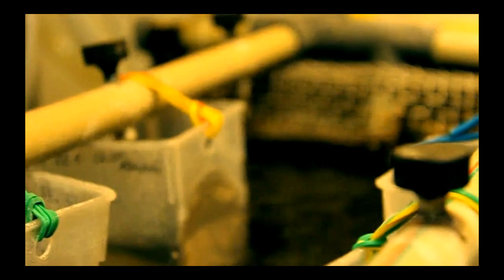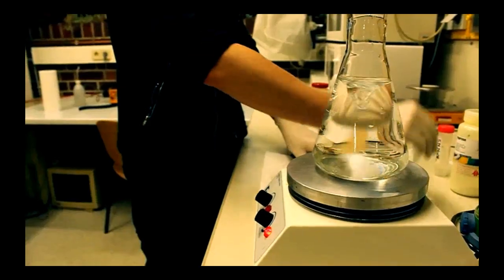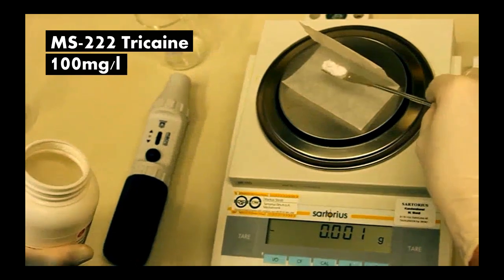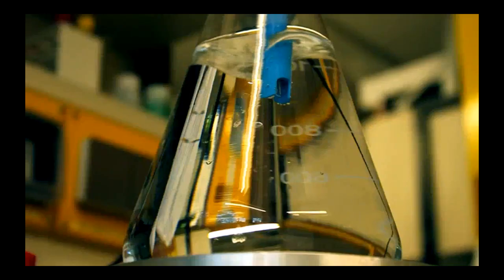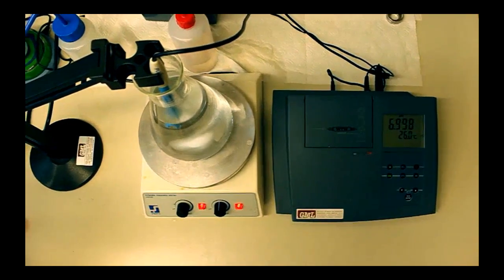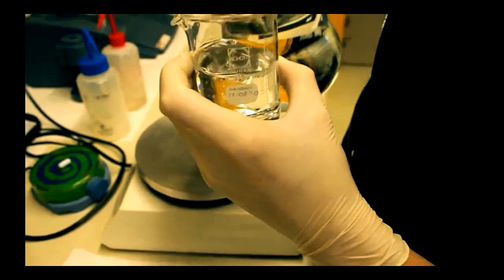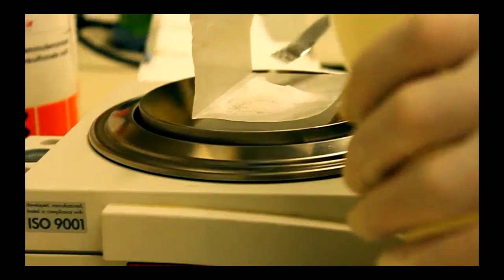Three days after fertilization, fish were prepared for microscopic analysis in an incubation chamber. For anesthetization, we prepared a solution of MS222 tricaine in water with an initial concentration of 100 milligrams per liter. As tricaine is acidic and lowers the pH value, we neutralized the solution with sodium hydroxide. To embed the fish in the incubation chamber, we set up a solution of 1.5 grams of low-gelling point agarose in 100 milliliters of tricaine.